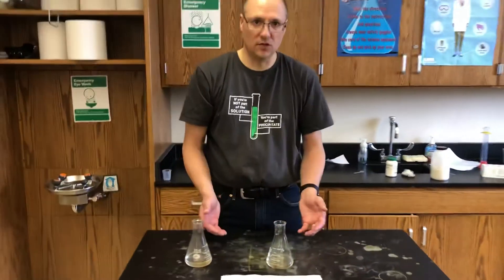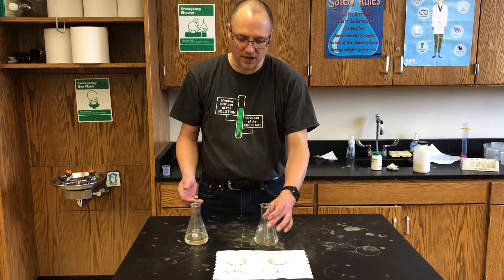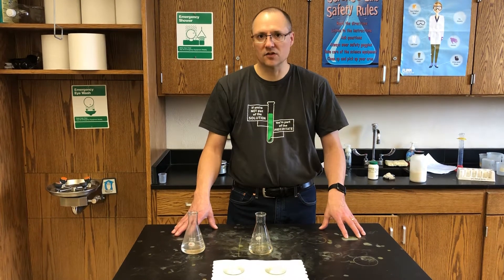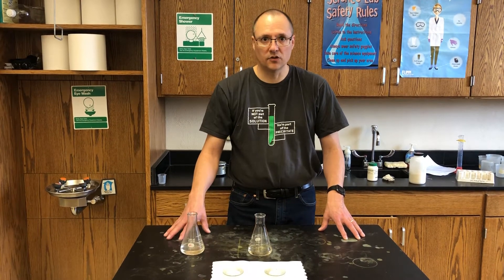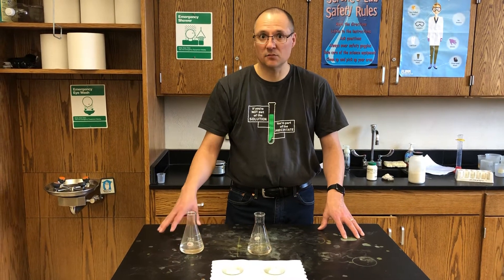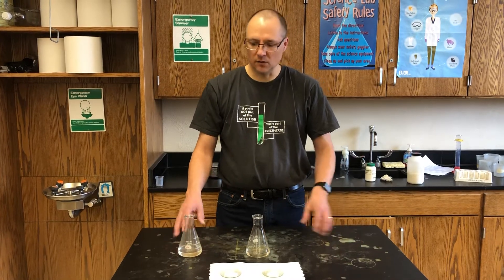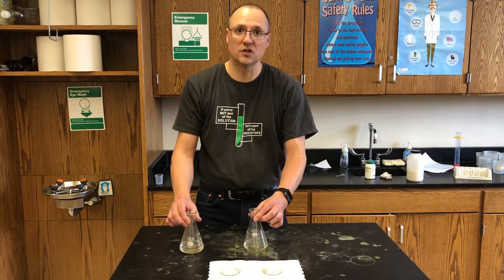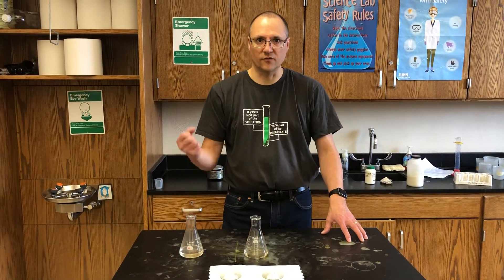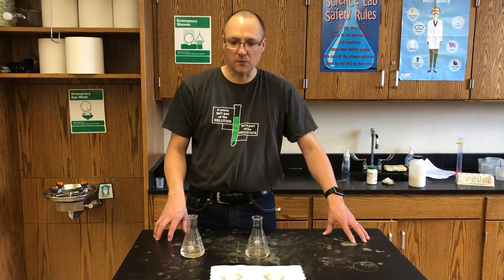Reactants go into the chemical reaction and products come out. There are four signs of a chemical reaction — these are signs of a chemical change: color change, temperature change, producing a gas (sometimes in the form of bubbles), and producing a solid. If you produce a solid out of two solutions it's called a precipitate — that's when a solid crystallizes out of solution, forming crystals as a result of a chemical reaction.